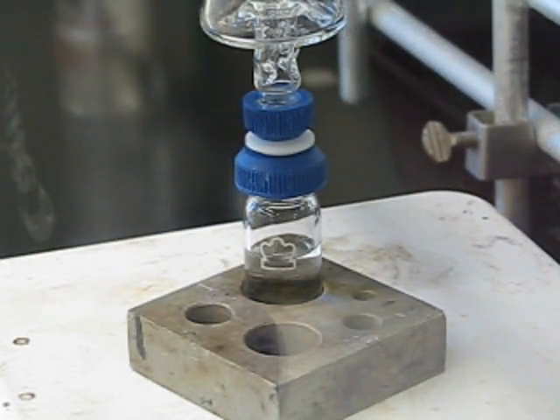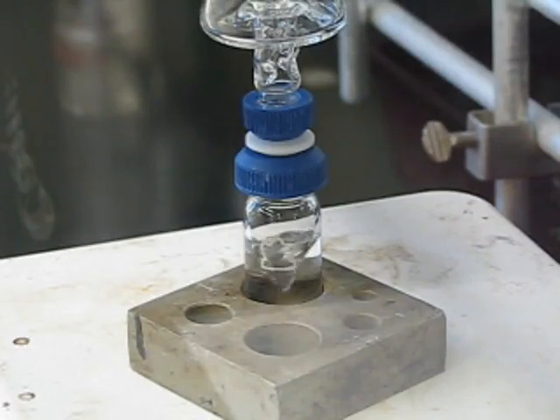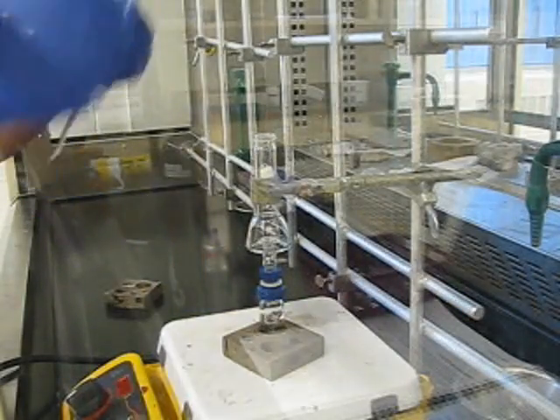In your vial, you'll put a stir bar, some boiling stones, and your mixture. You want to get that on the hot plate, clamp it — either via the distillation head or the vial — and have it sitting within an aluminum block. Get a vortex going in your vial to ensure that the mixture is stirring fairly rapidly before you start heating.